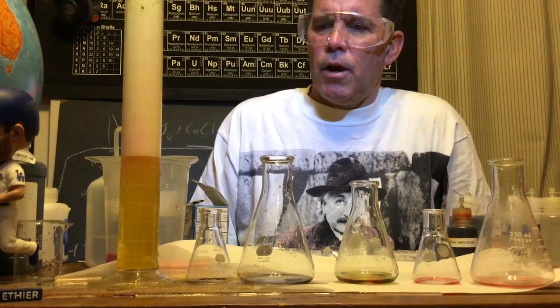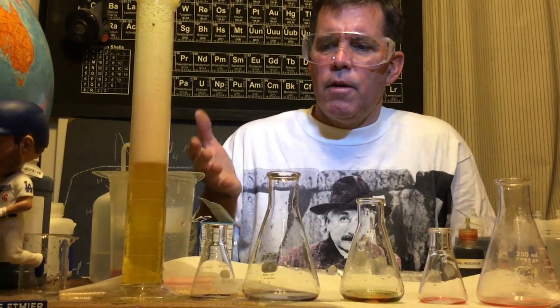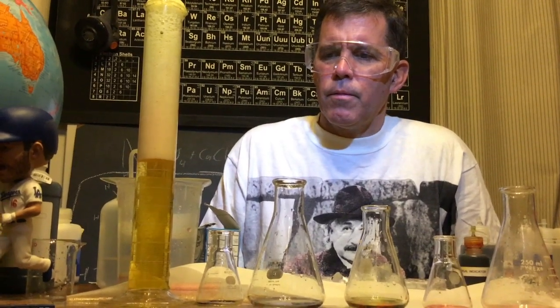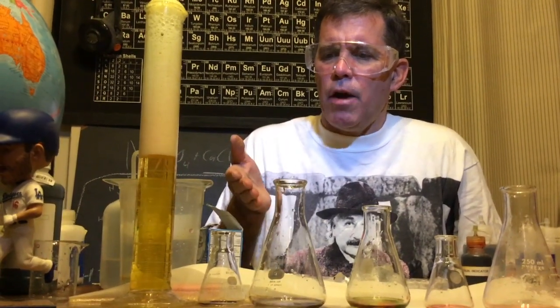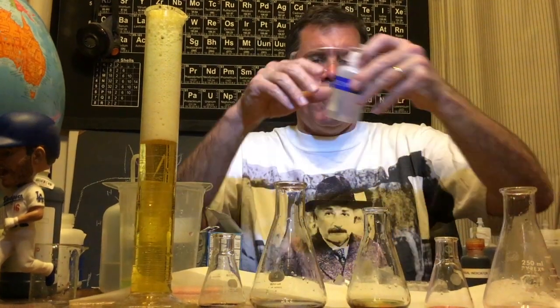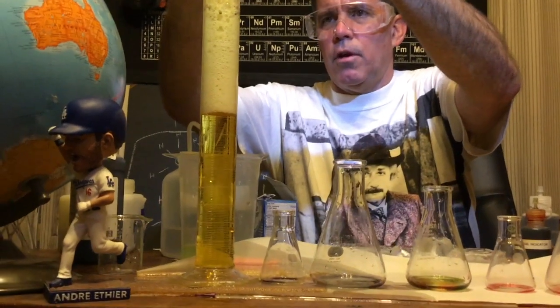Why did it do that? That's because it produced carbon dioxide, as that was the gas that was produced. And carbon dioxide actually reacts with water to form a weak acid. Now what would happen if I put some sodium hydroxide in there, just for fun?